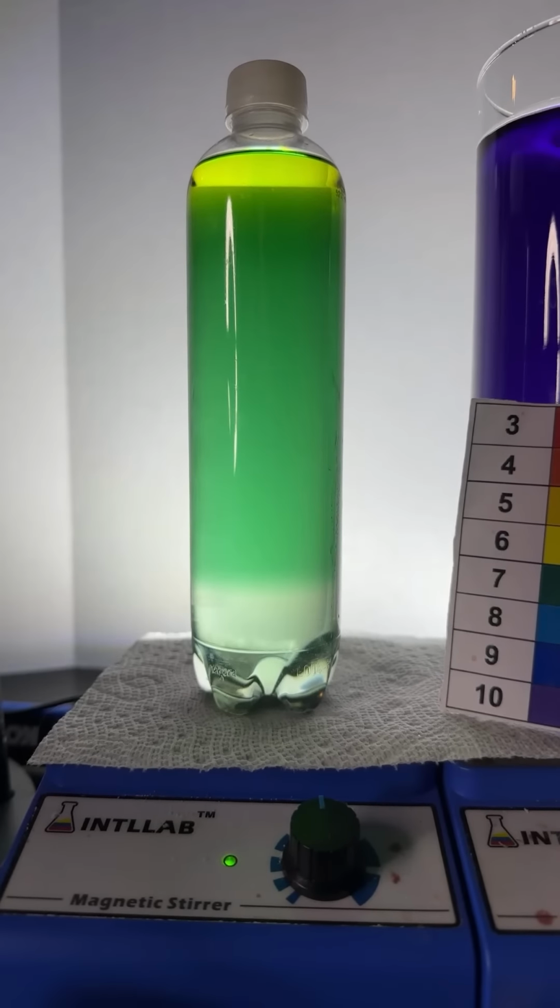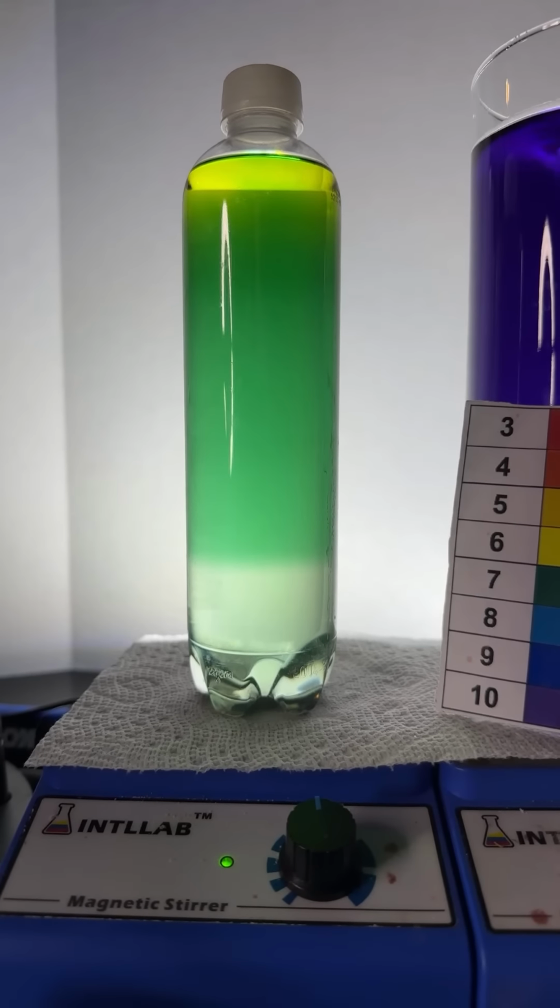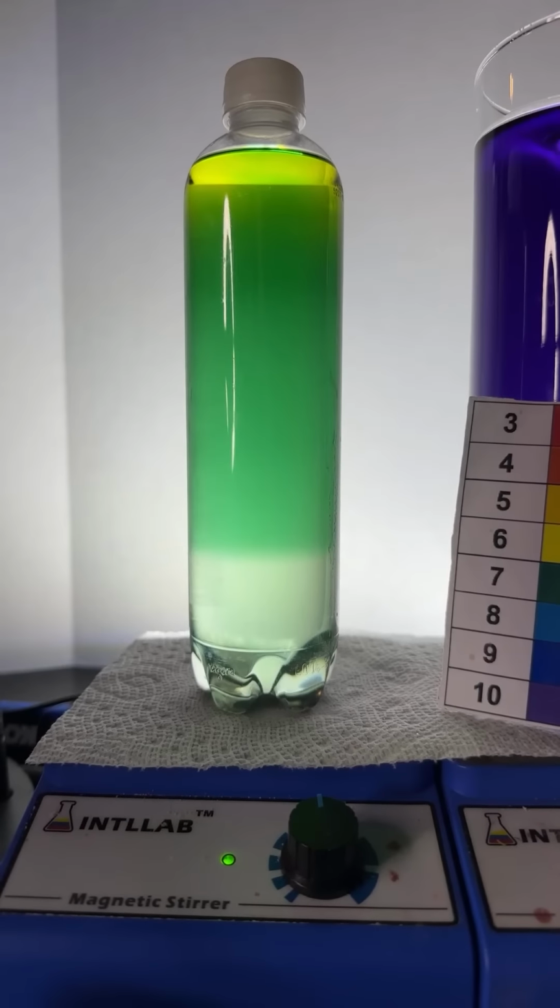Oh, cool, Skylar. Classic test for checking if you converted all your salicylic acid to aspirin. Thank you there, Twinkle. Yeah, I thought aspirin doesn't contain a phenol. Yep, indeed. Thank you there, Eric Lee.